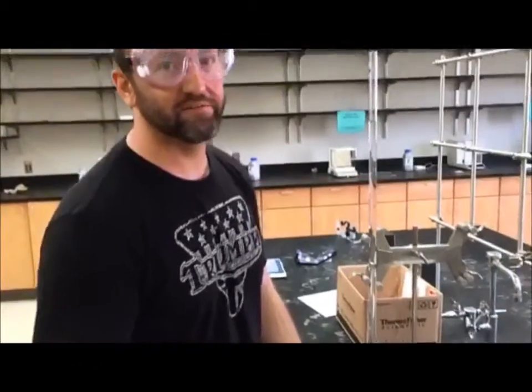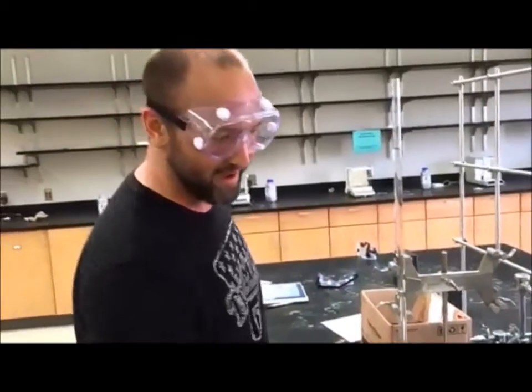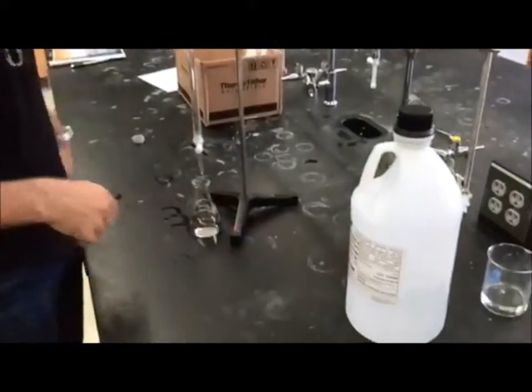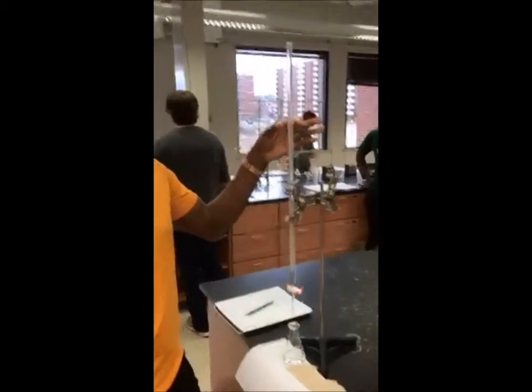So a titration is a form of analysis to determine the concentration of an analyte in a solution. Just doing a little titration. Fortunately, earlier we primed the burette by washing it 3 times with water and then 3 times with the solution of sodium hydroxide. All right, guys, right here we have our burette, which is filled with NaOH.